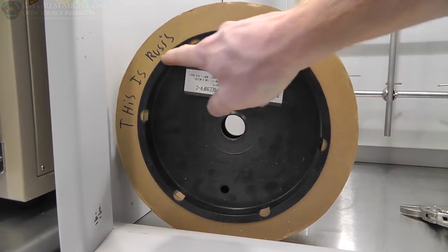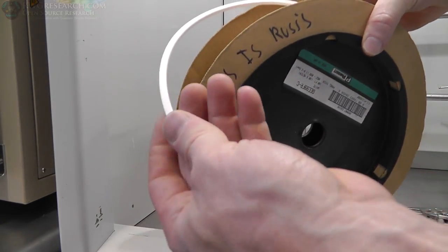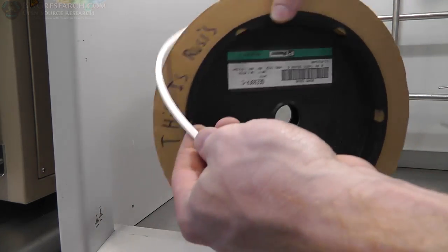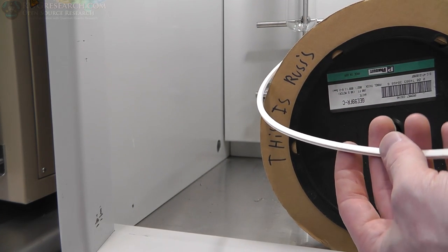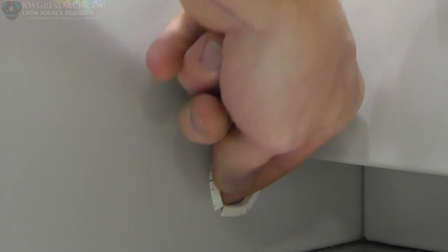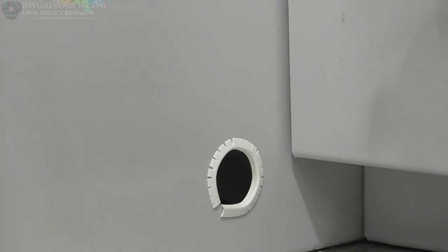This is Russ's. This is Panduit edge covering that I got from, believe it or not, a yard sale. So it's a whole roll. Official Panduit. It's good stuff. This is what we're going to put on that edge so we don't have a sharp edge. All right, there you go. So it just fits on that edge. Pop it on there. Now we don't have a sharp edge.